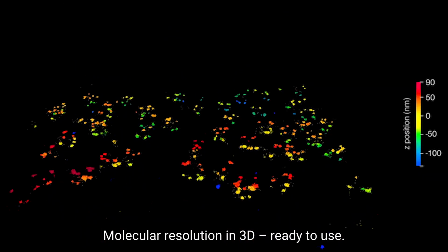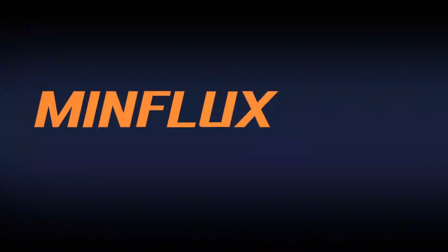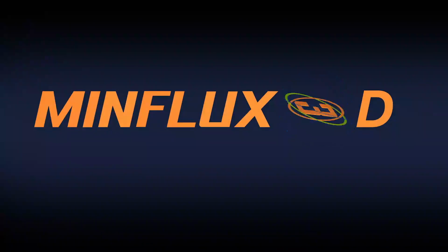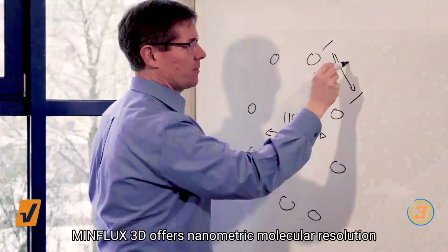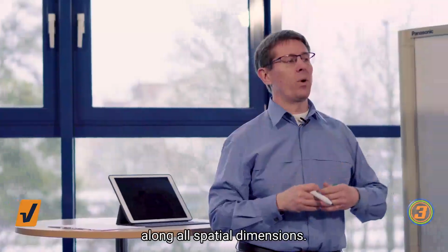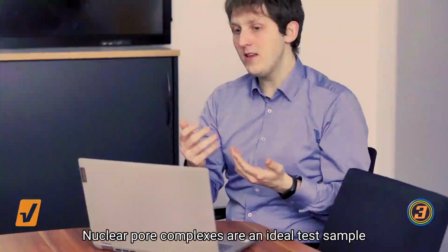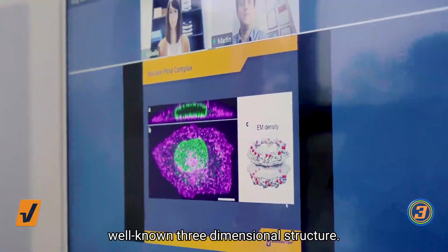Molecular resolution in 3D, ready to use. MINFLUX 3D offers nanometric molecular resolution along all spatial dimensions. Nuclear pore complexes are an ideal test sample because of their size and their well-known three-dimensional structure.